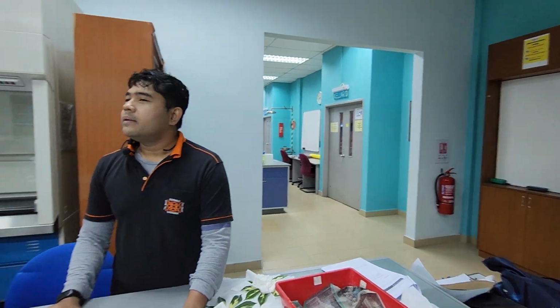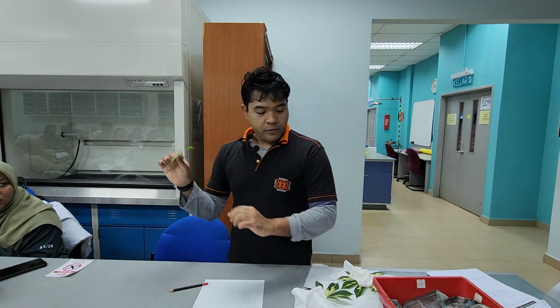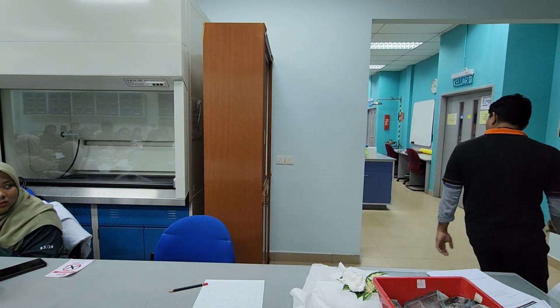Okay. Let me think. You know what? Even though I explained that first, I think in sequence you should be doing manual first, because this is non-destructive. Okay. However, this leaf is rather wet now. Use the paper towel. If you need more paper towel, it's over here.